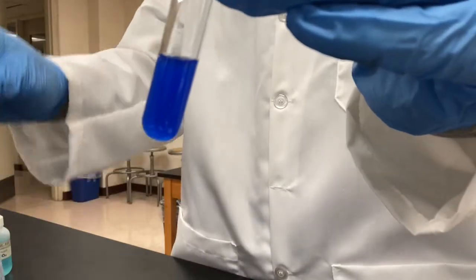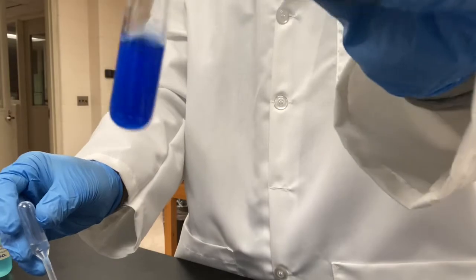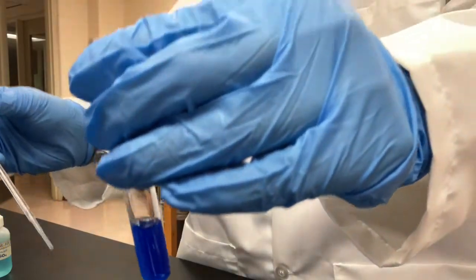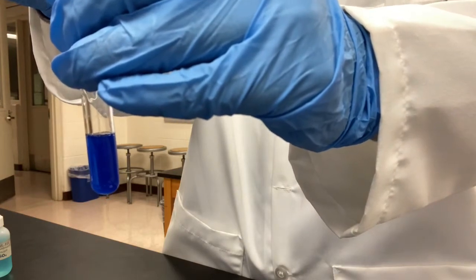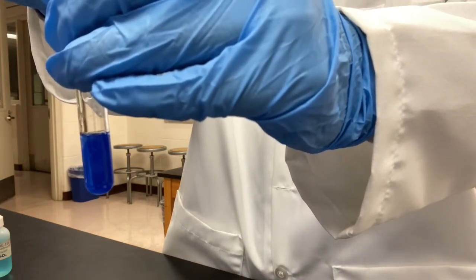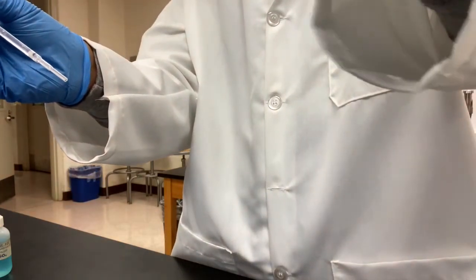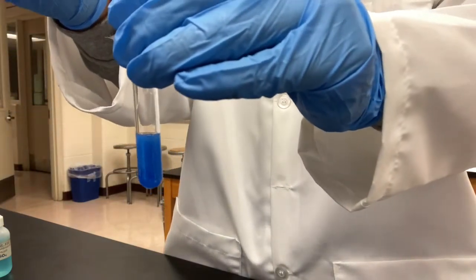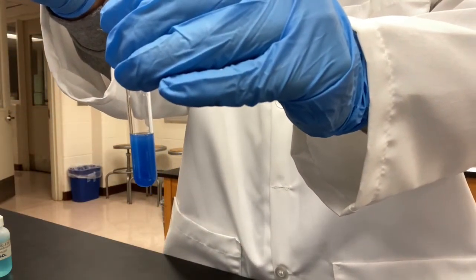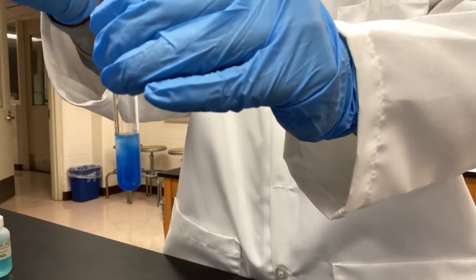And we'll take a record of how many drops of hydrochloric acid are needed. 1, 2, 3, 4, 5, okay. 5, 6, 7, 8.